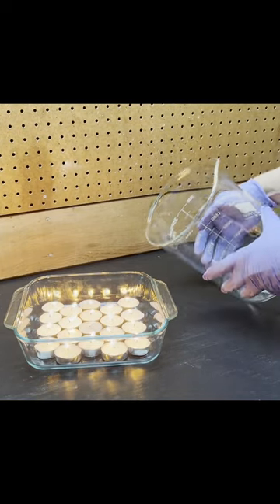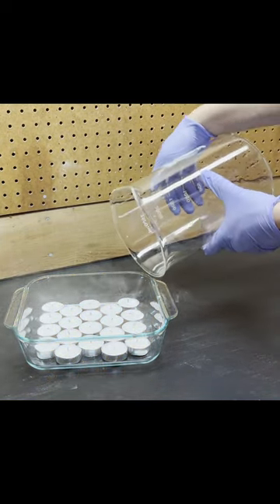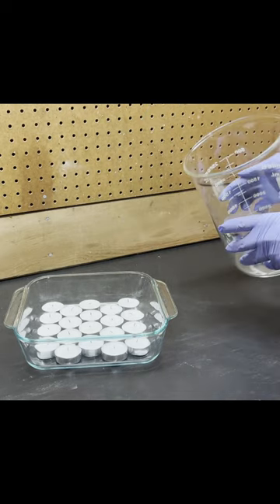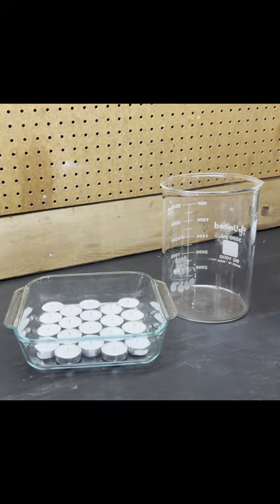This beaker looks empty, but it can put out fire. Inside it is something we're all familiar with: carbon dioxide.